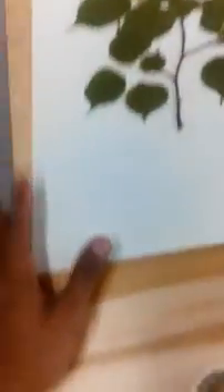Maybe another video with some of the tape sizes and everything. But a couple things to keep in mind whenever you guys are doing your specimens: you want to make sure your specimen looks nice on the page and it also gives an accurate depiction of what the plant looks like in the real world.